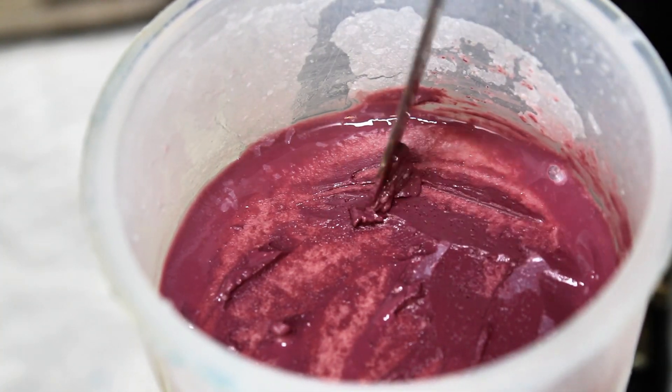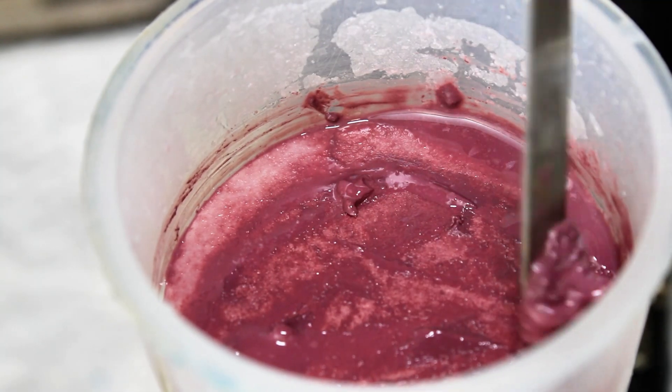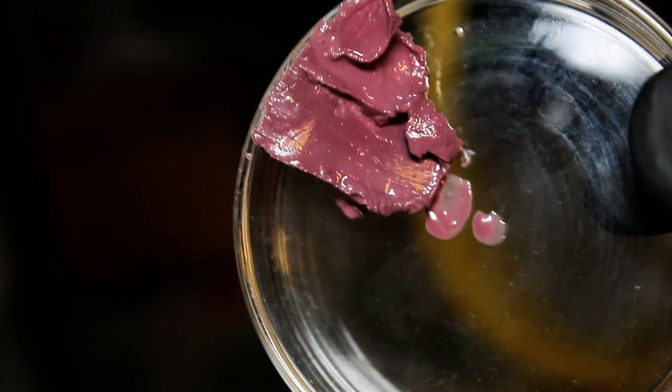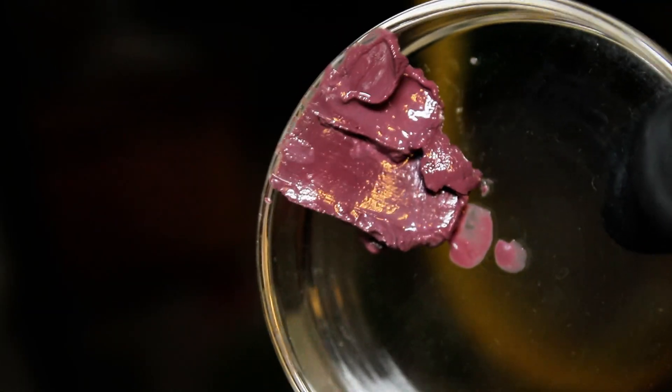This was scraped into a dish and dried under vacuum desiccation for a while, and here you can see my barium ferrate, which represents iron in its +6 oxidation state.